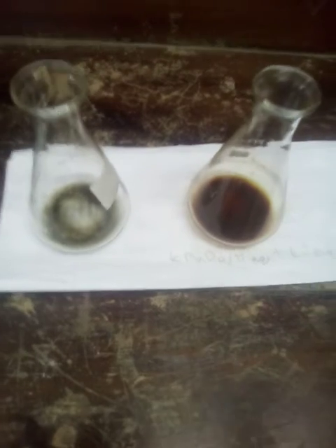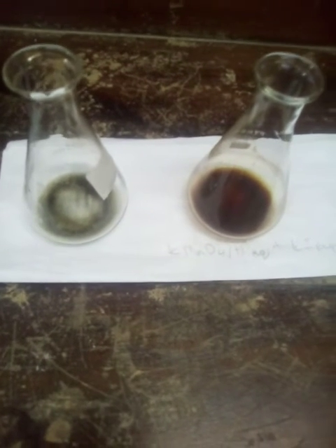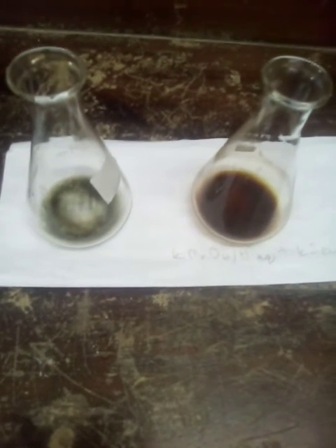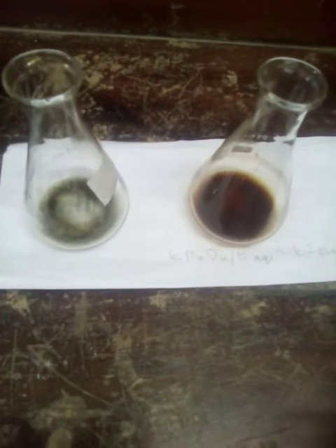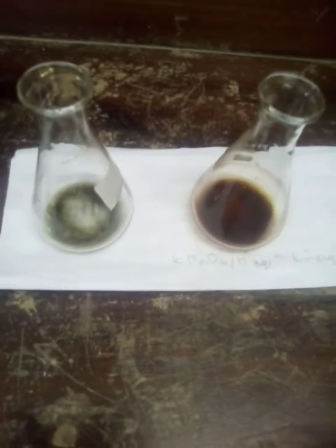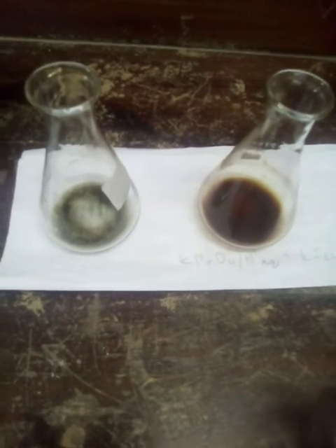Alright, so today we learned of a particular way that we can use to identify iodine in a mixture or in a solution. Once elemental iodine is formed, we can react the solution containing the iodine that we suspect is there with some starch solution and see what is the end result.